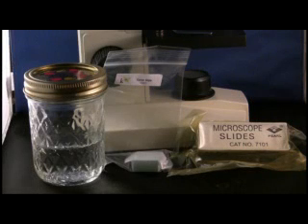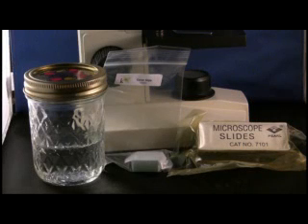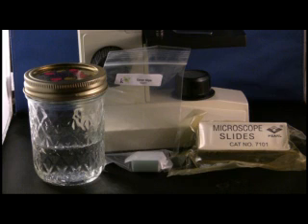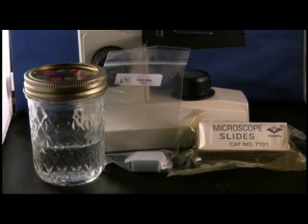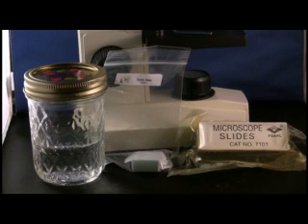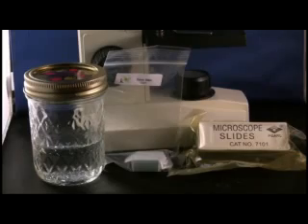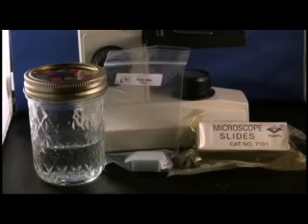You will need the following materials for this lab: cover slips, microscope slides, and a compound microscope. You will also need soil, pond water, an eyedropper or pipette or straw, and tap water.